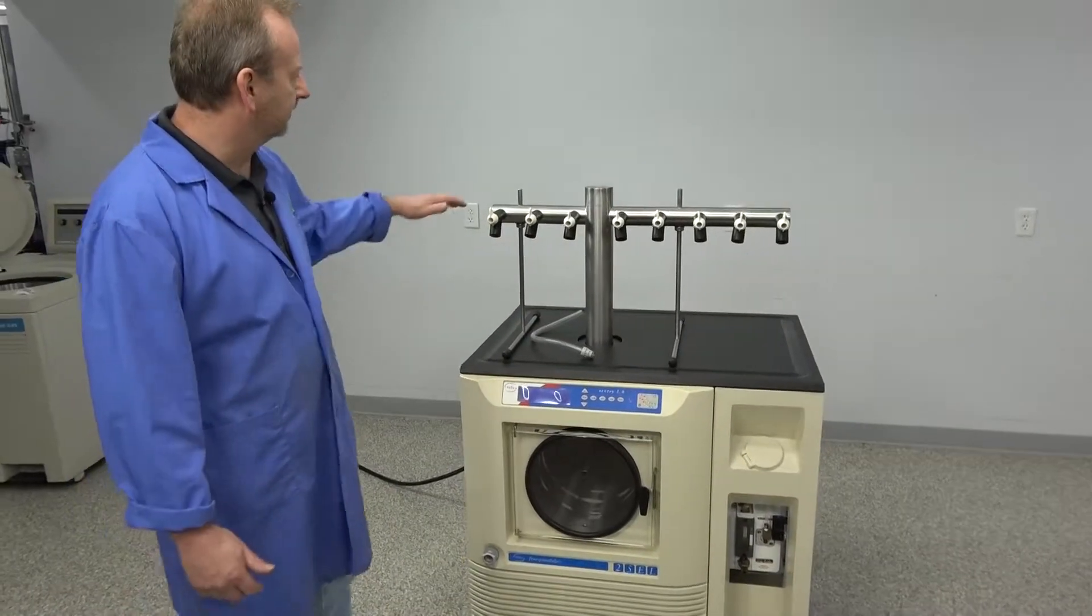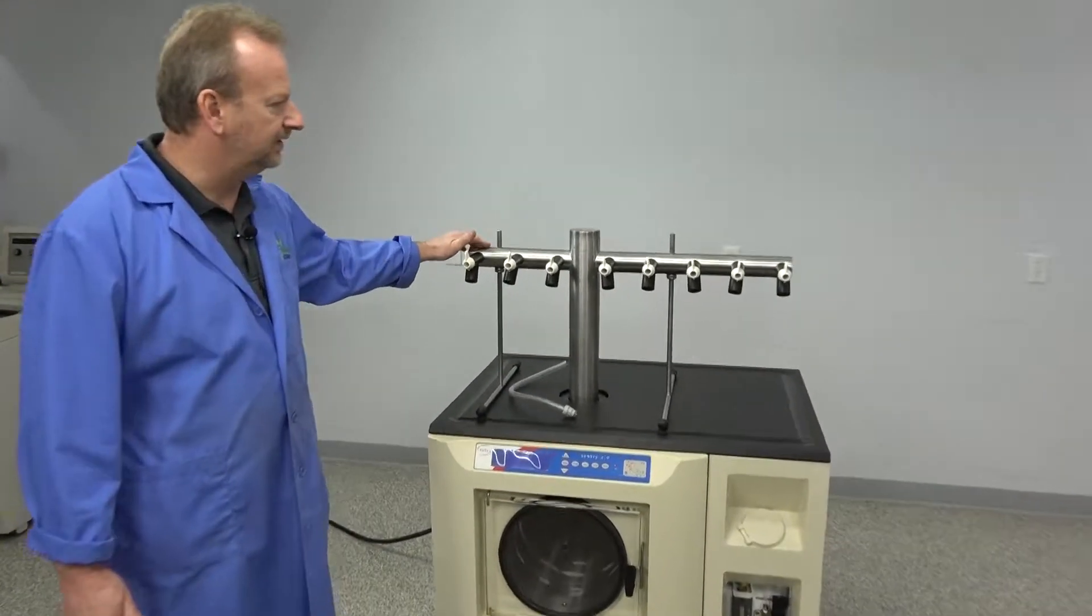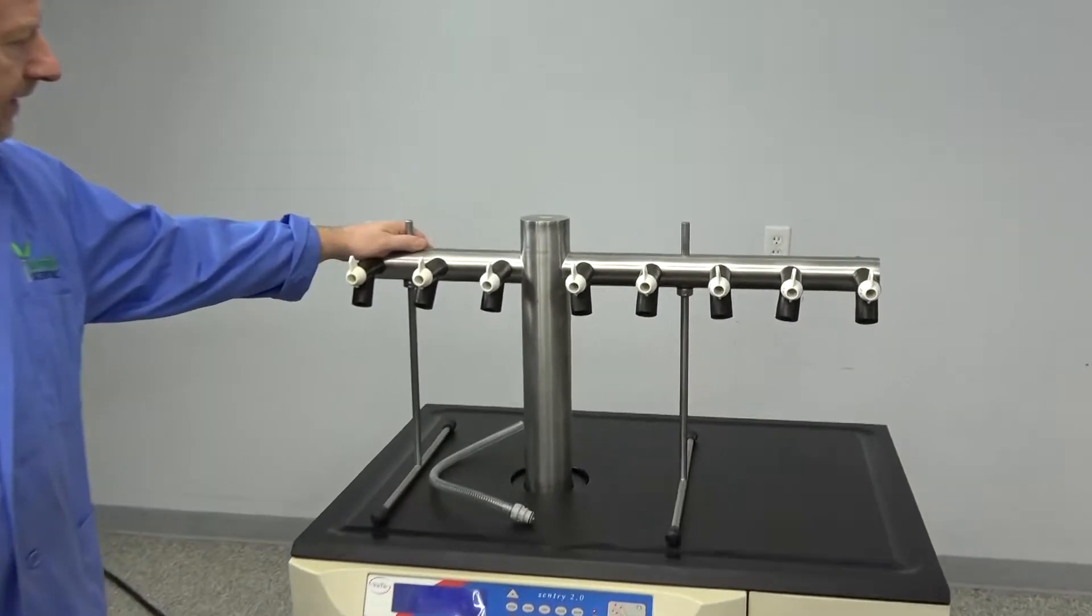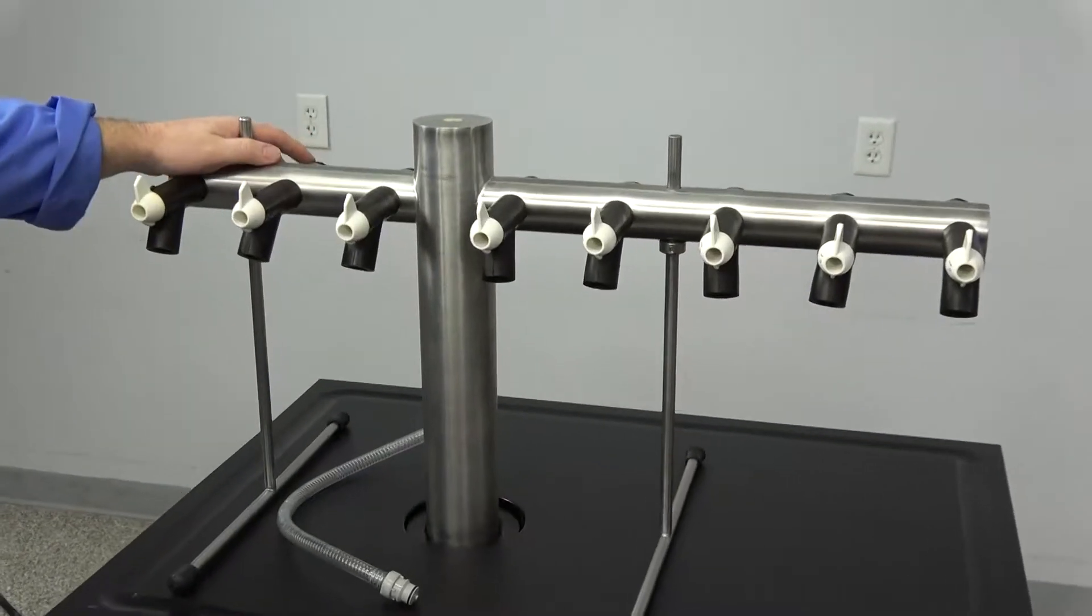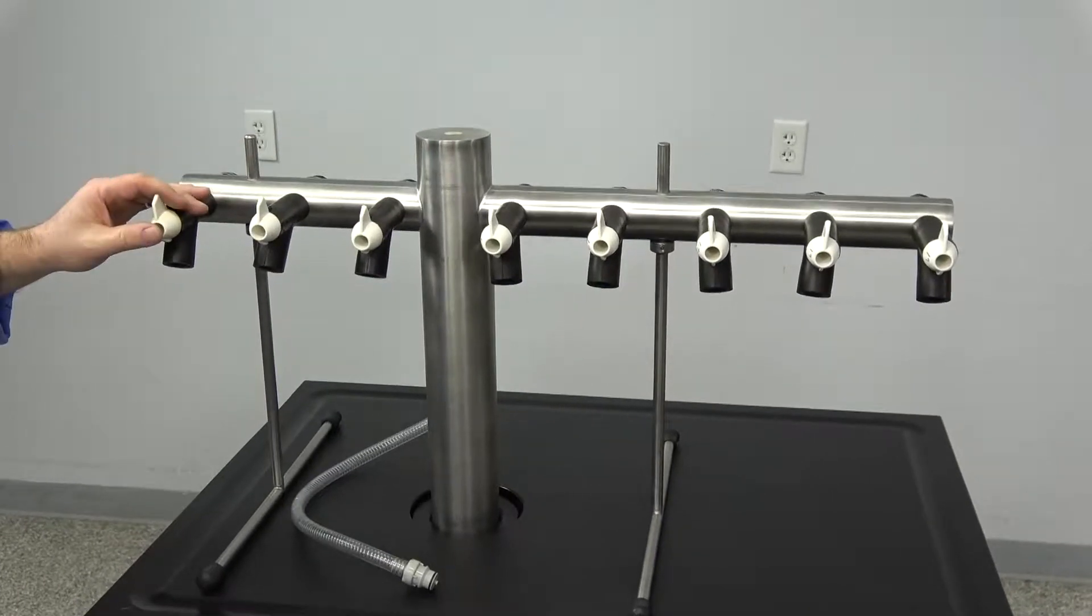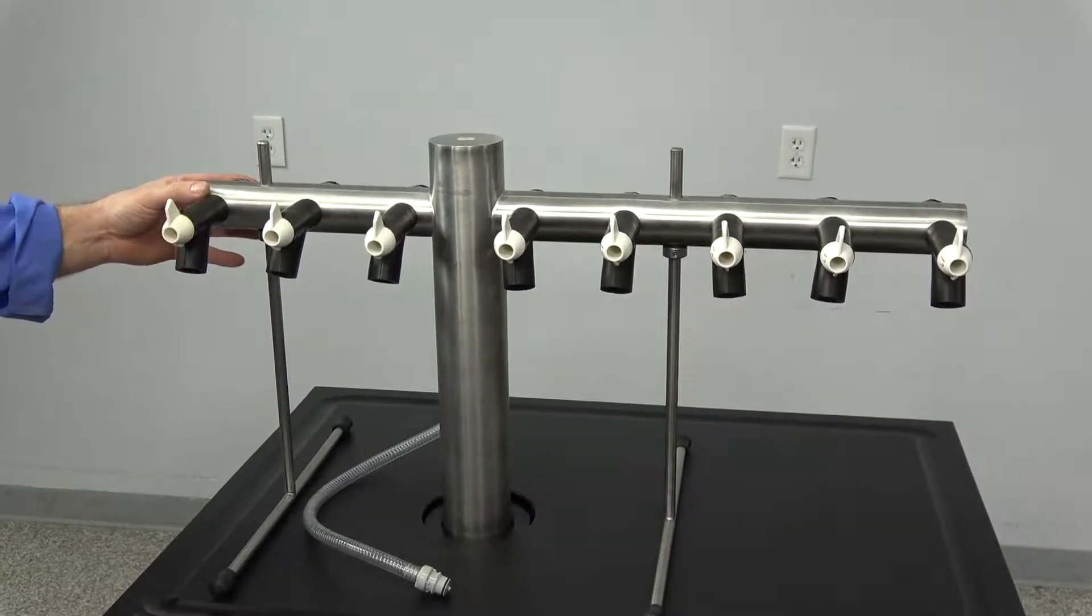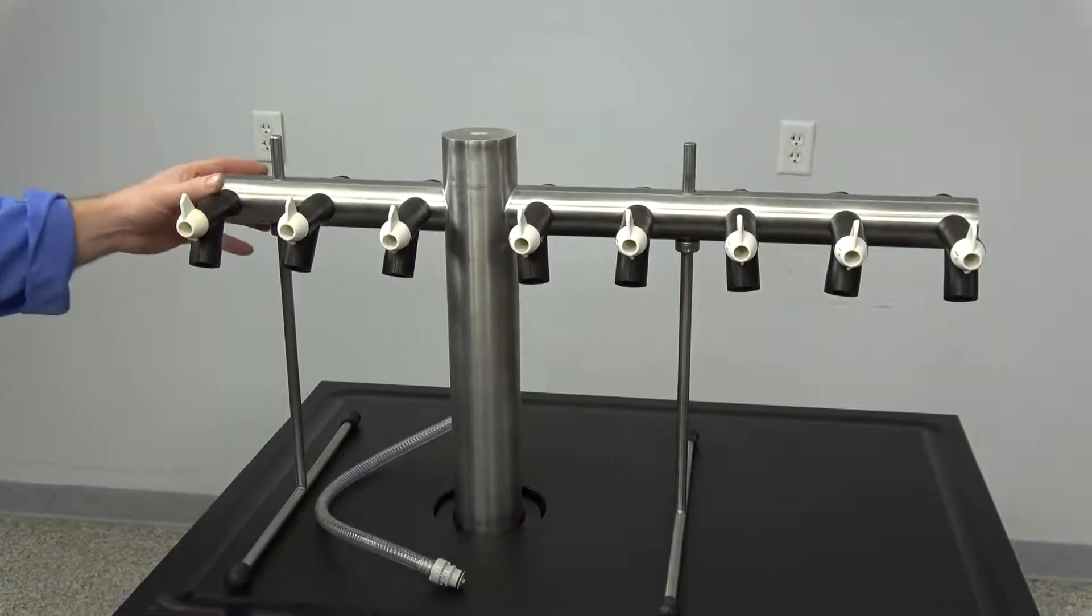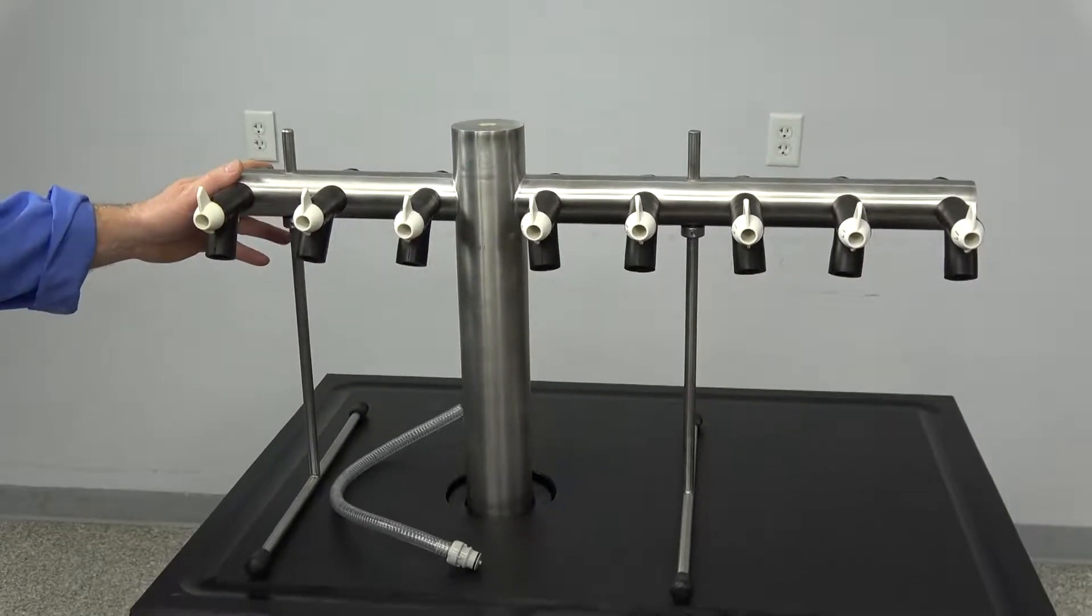We'll start at the top here. This unit does come with a 16 port manifold, and we're only offering the eight valves on front here. We've just plugged the back ones, but you can upgrade and put the full 16 on it.